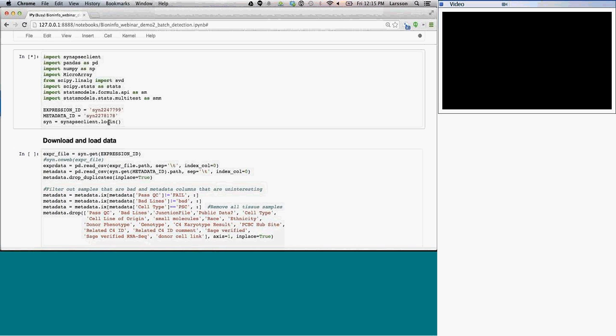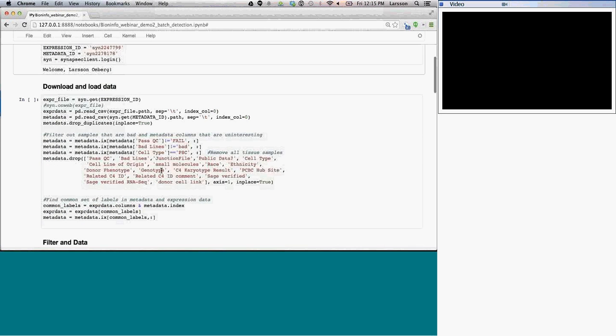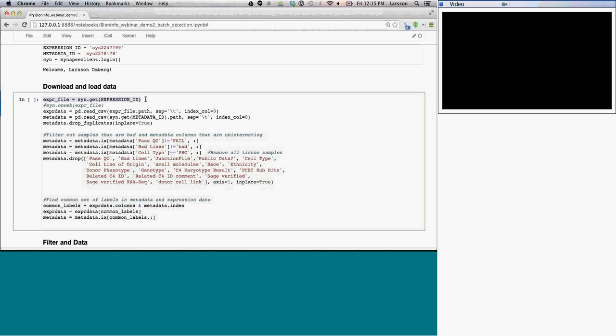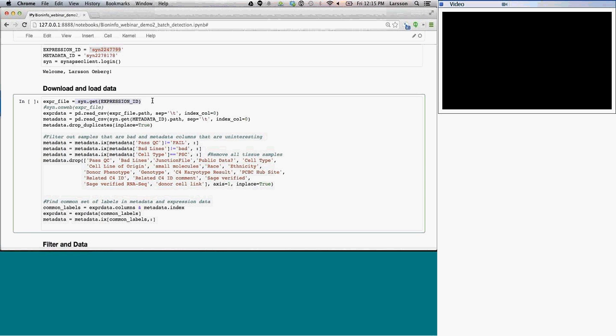So I control-click to run this, and it runs now. It's actually connecting to Synapse. It says, "Welcome, Larsson Omberg." I'm now logged in. And the next thing to do is I'm going to fetch the data. With this command right here, I've given the ID that I gave above for the expression data, and I just do synGet expression data.